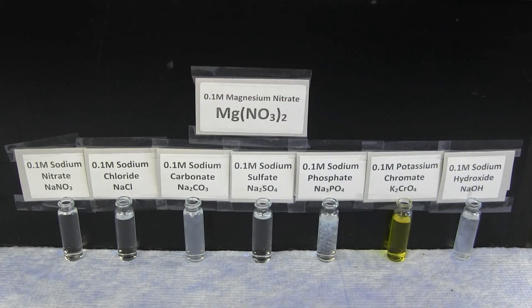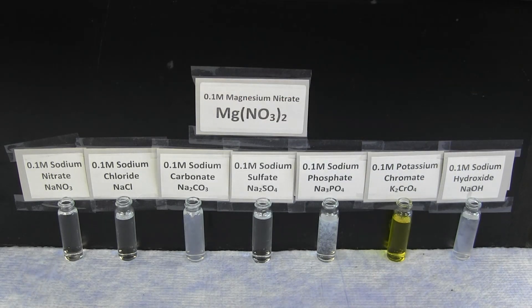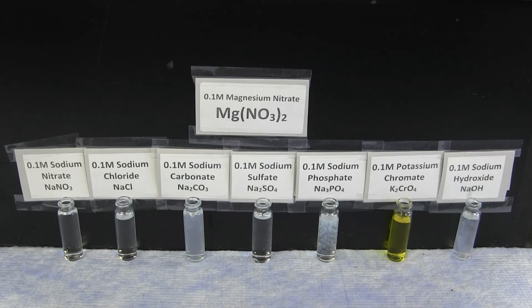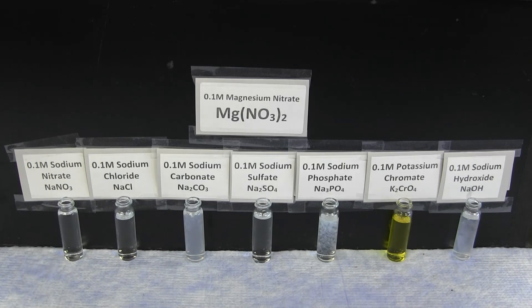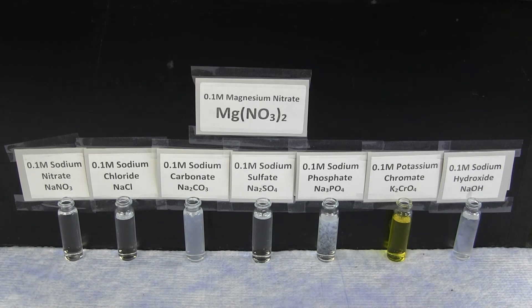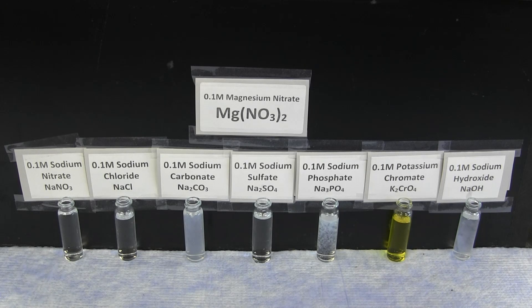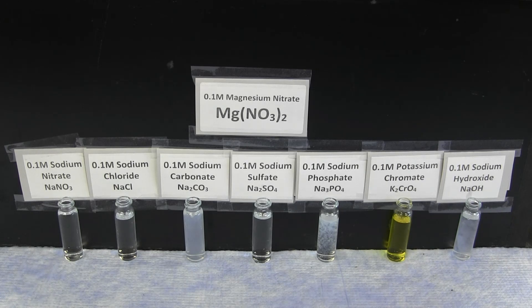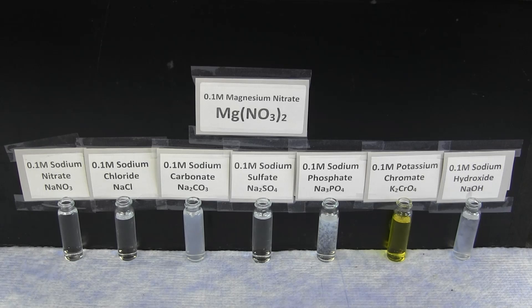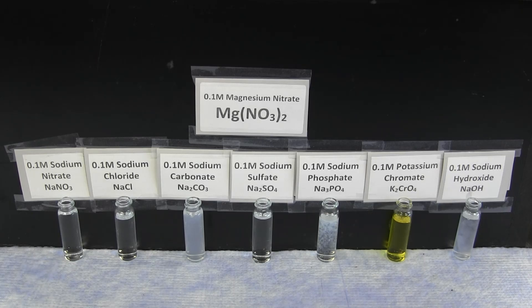With magnesium, there is a slight white precipitate with sodium carbonate and a white precipitate that forms with sodium phosphate and sodium hydroxide. There is no precipitate formation with sodium nitrate, sodium chloride, sodium sulfate, or potassium chromate.